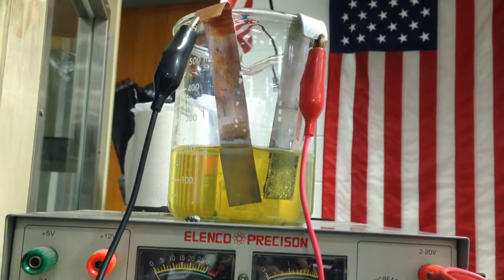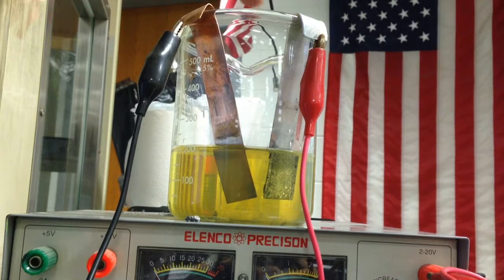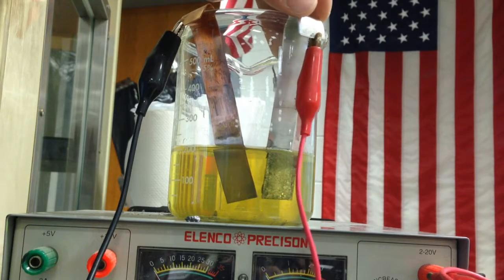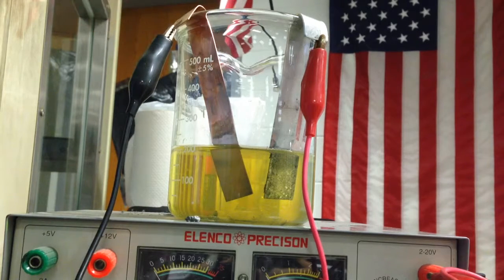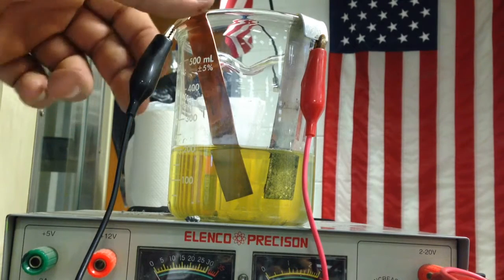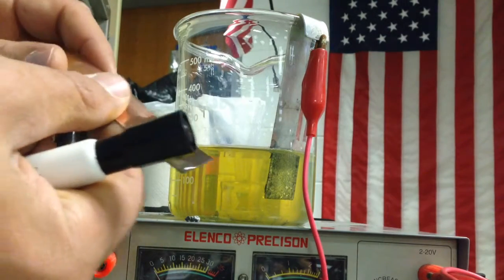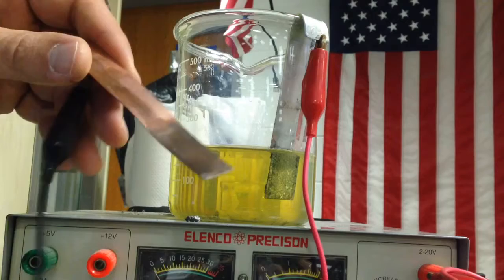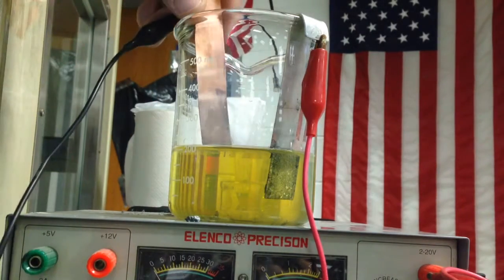So I have a solution of tin chloride, which is usually pretty insoluble, and I have copper, hopefully, and I have my tin, my pretty metal tin here. As I have done previously, we showed that copper placed in tin chloride is non-spontaneous. It's sitting in tin chloride, and right now I can see that there is absolutely no tin being plated here.